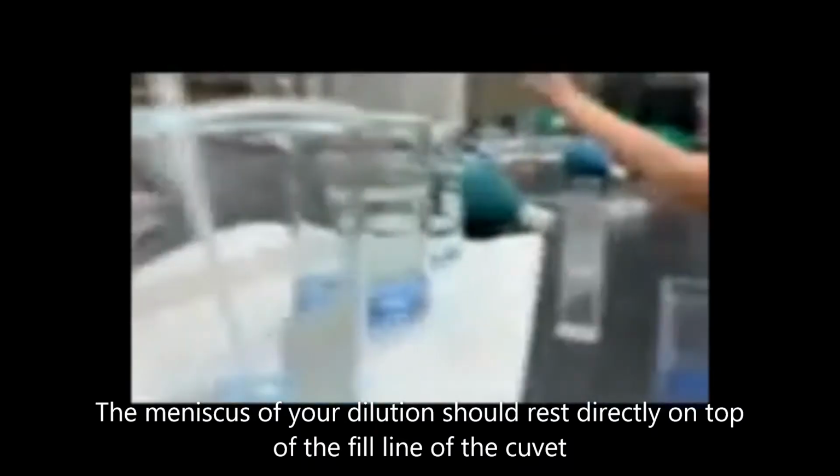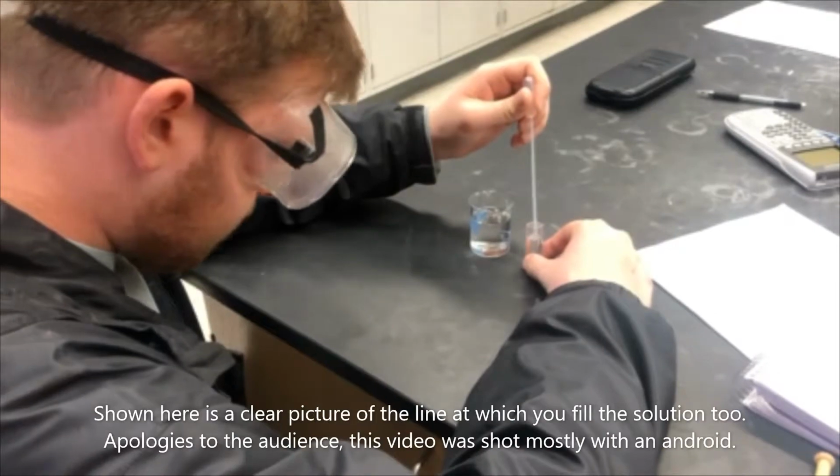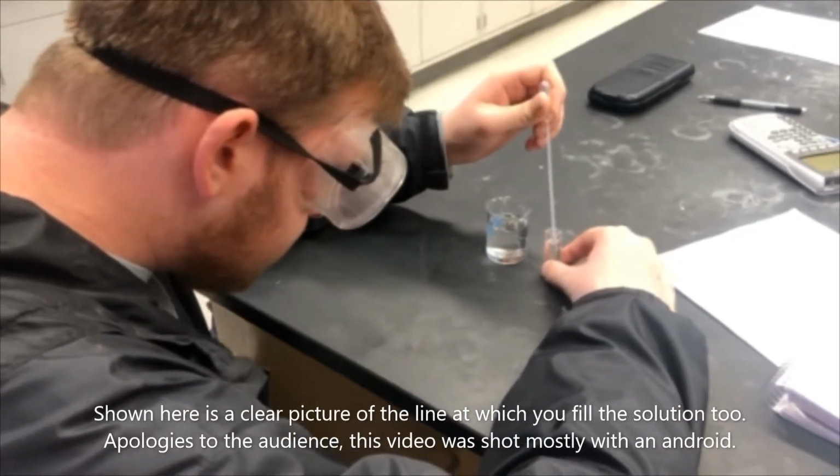Because we are using the spectrophotometer, we have to prepare a cuvette with water in it to have a blank to zero the spectrophotometer. This water is filled to the line where all the other solutions are filled to, shown here.